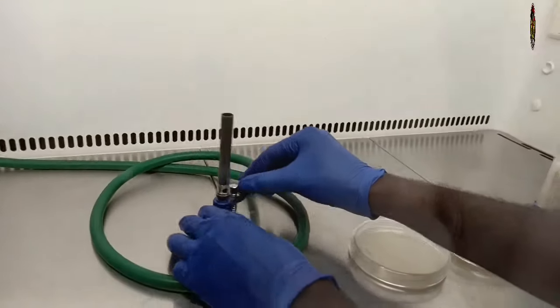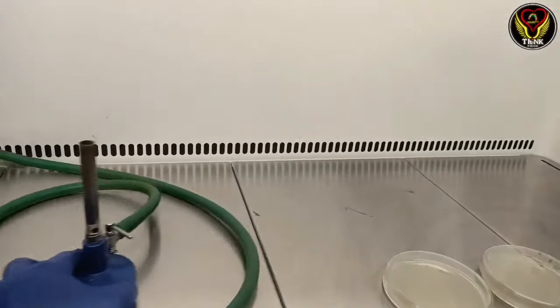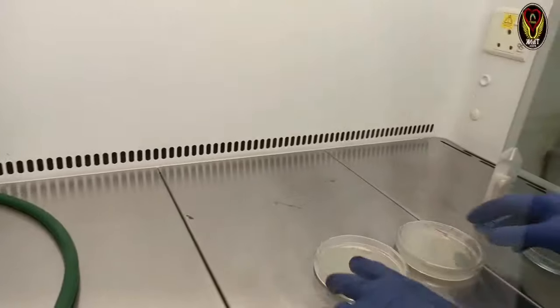That prevents gas leak. If we turn off the bunsen burner first, there will be gas circulation which is dangerous.